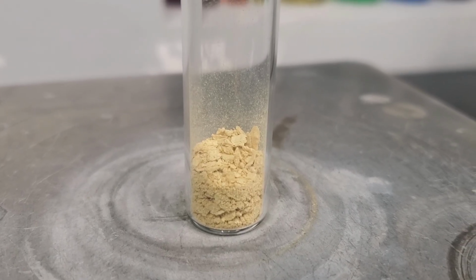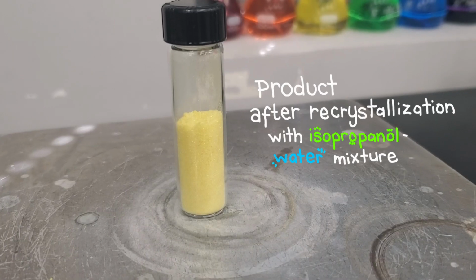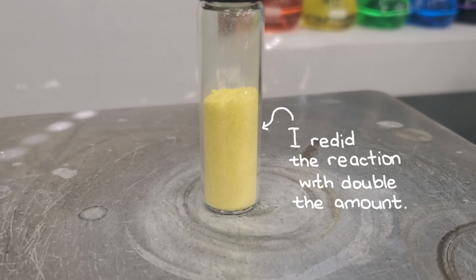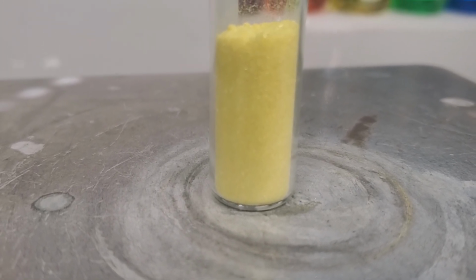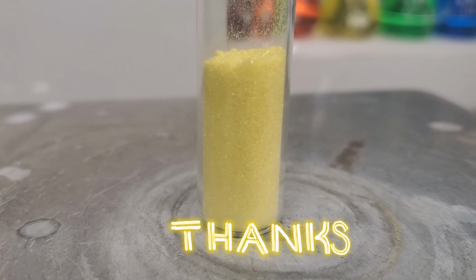Overall, this synthesis shows how vanillin can be converted into dehydrozingerone through a classic aldol condensation and how changing the ionic liquid can influence the practical outcome, even though my substitute ionic liquid did not give an optimized result. The reaction still worked. Thank you so much for watching.